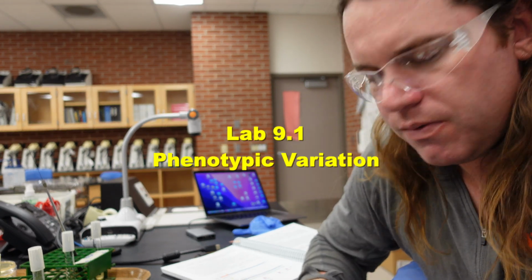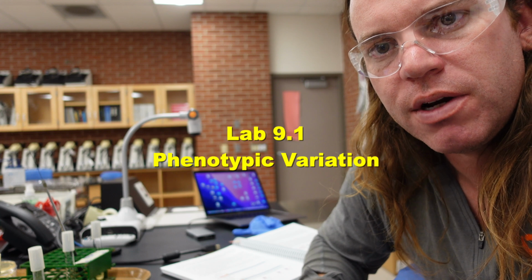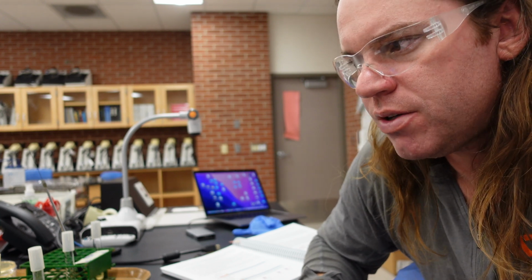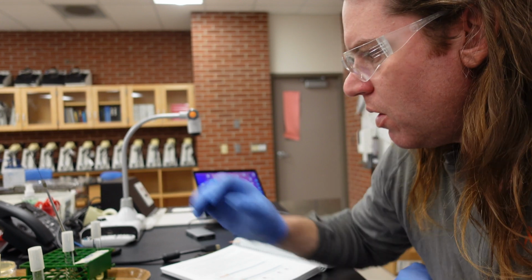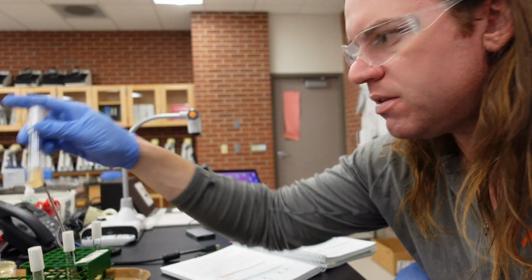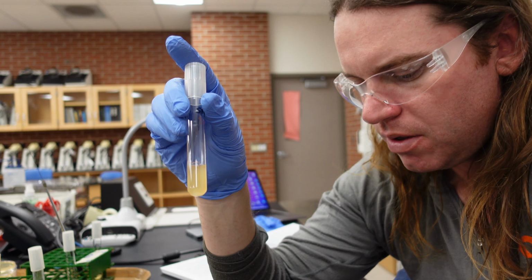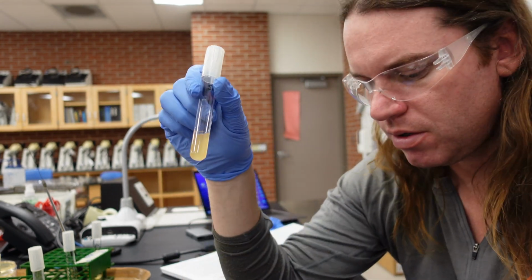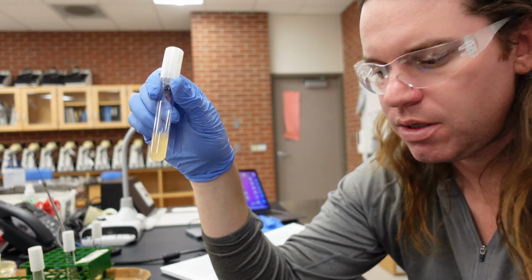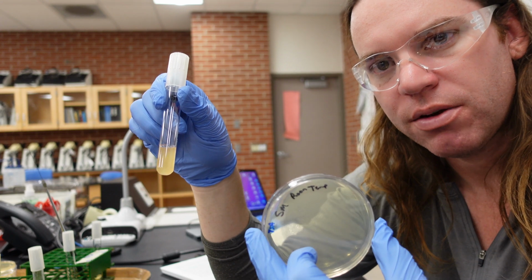Hey everyone, in this video we're going to be conducting the experiment for Lab 9.1, which is phenotypic variation. And phenotypic variation is basically a way some cells will regulate their gene expression based off of environmental factors. We're going to use Serratia marcescens, which has the ability to produce a red pigment at one temperature, and it does not produce the pigment at the other temperature. So I'm simply going to do a streak plate of Serratia and incubate it at 37 degrees Celsius, and we will incubate the other one at room temperature.